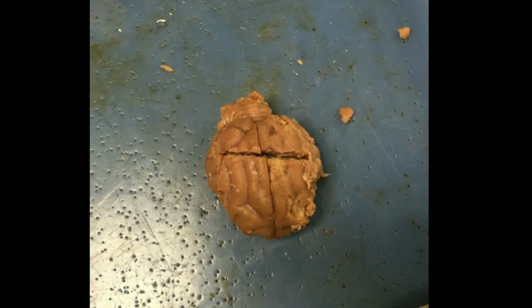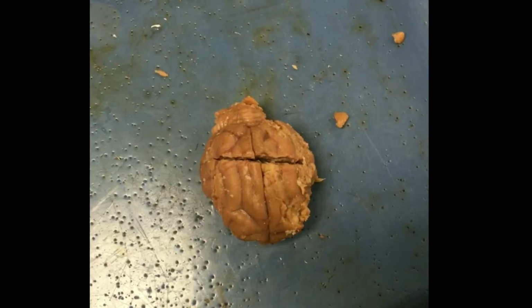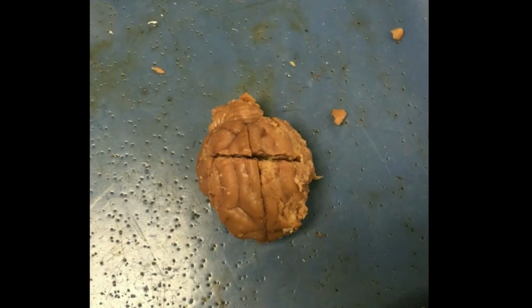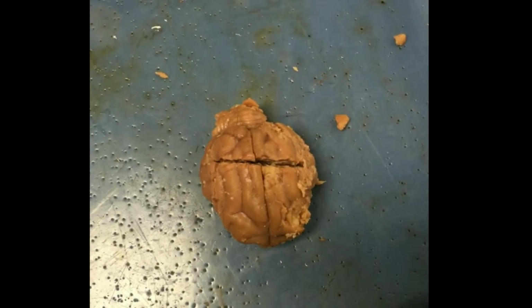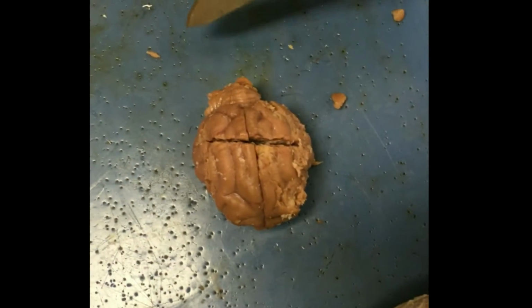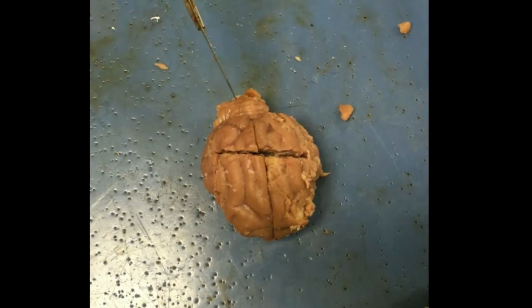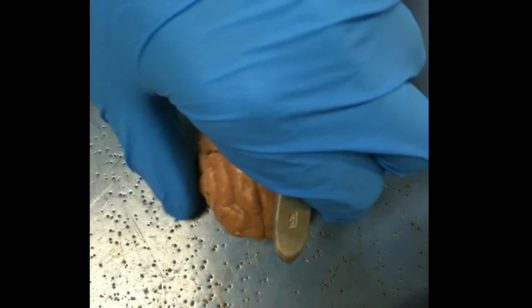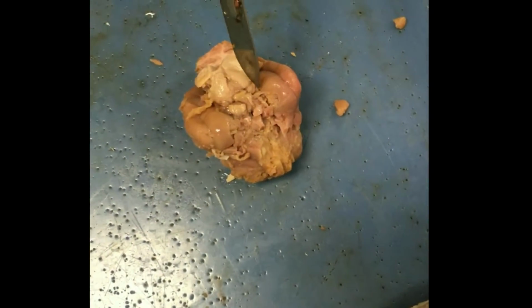For the nervous system, the brain is the main organ. The brain controls the network for the body's function and abilities, enables conscious communication with our bodies, and it controls the sensory organs. The brain stem would be right here, but it is in the cat still. This is the cerebellum, and this is the cerebrum, and then the back, right here on the sides, would be the midbrain.